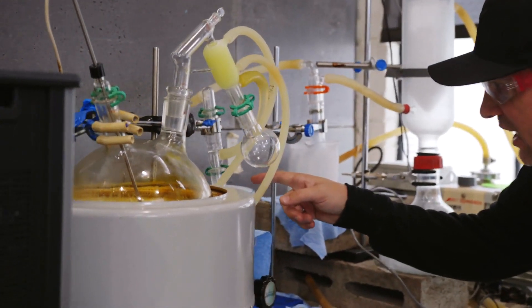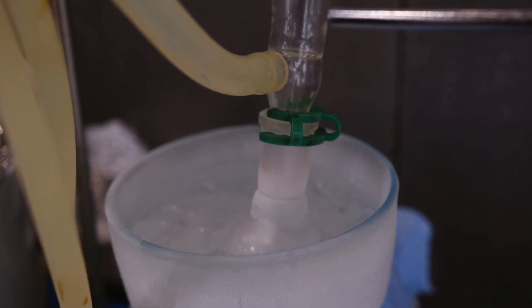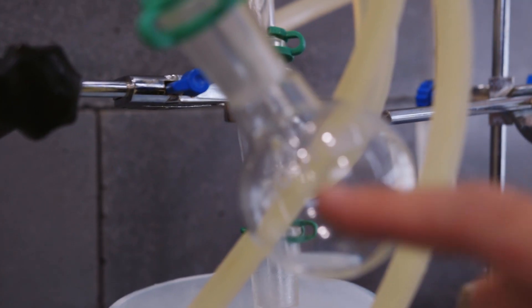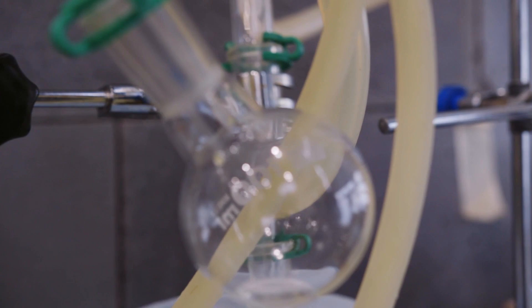And if you take a look, you can see how quickly—it's very active—you can see how quickly the terpenes are going in there. You can also see a little bit of droplets right there.